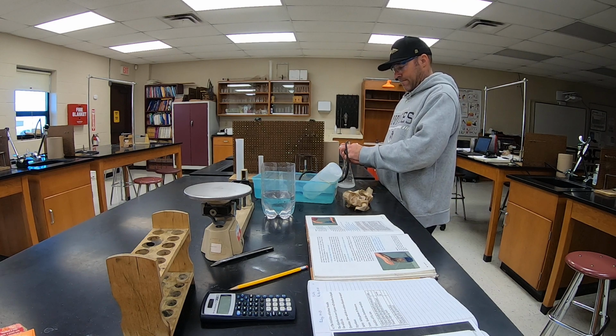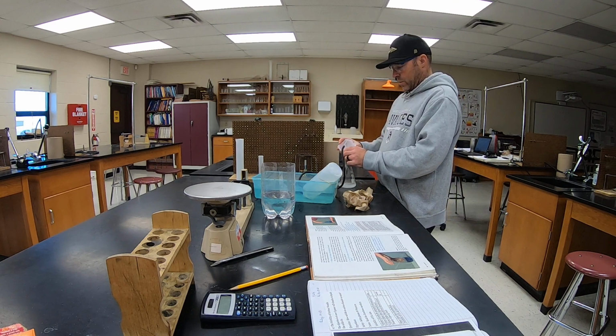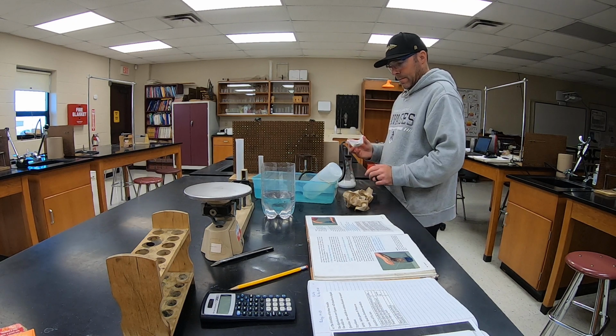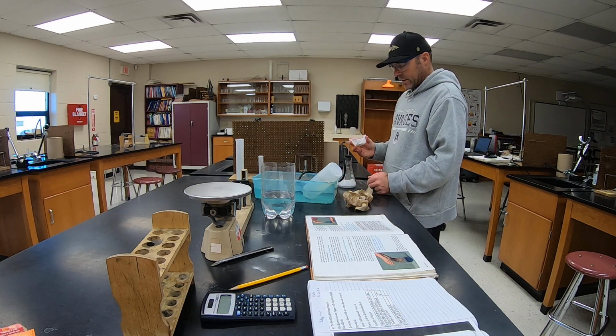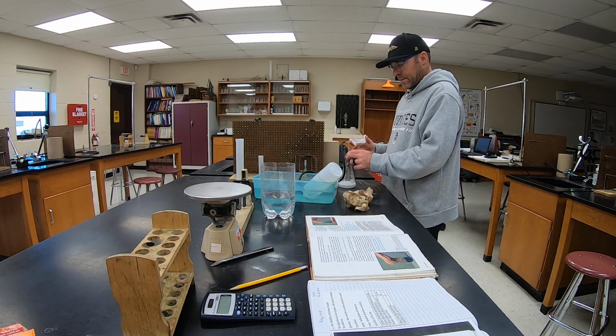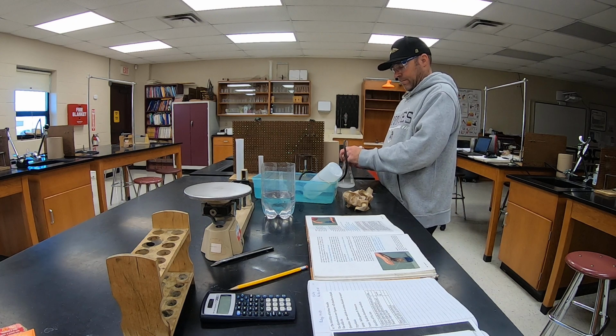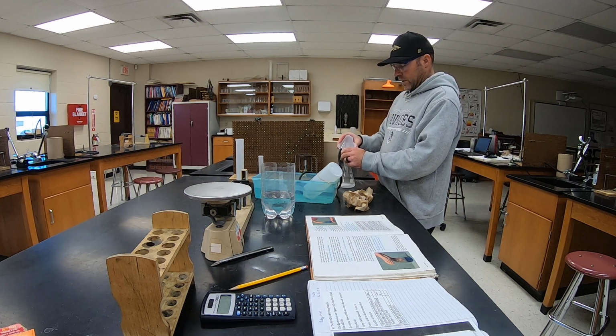And I'm going to add a little bit more, until this bottle gets completely full. Add a little bit more to it.